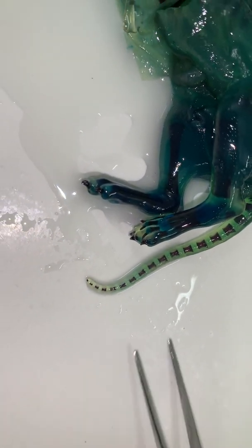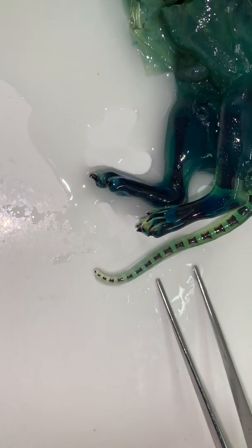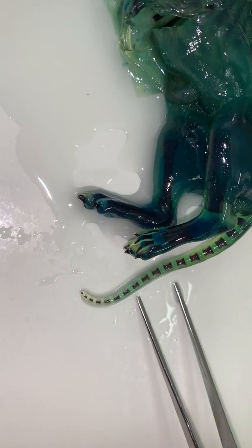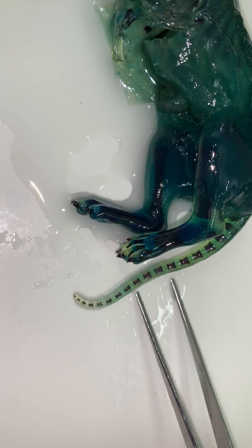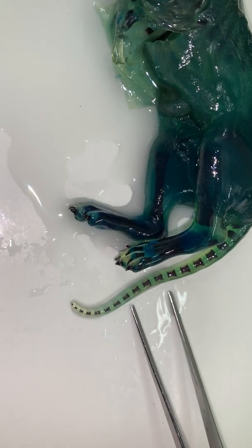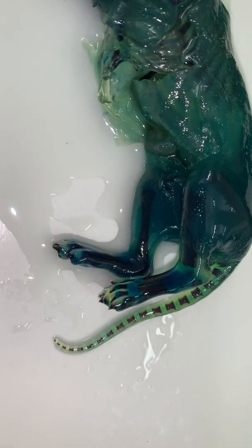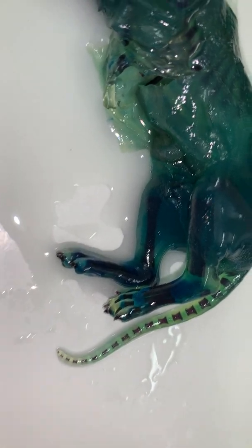So the vertebrae, we see that there's spaces in between the vertebrae. And again, that would have been cartilage. And the vertebrae ossify from the center outwards. And when that cartilage is used up, then it won't grow any further. So that is endochondral bone. Where we see most of the intramembranous bone is in the skull.